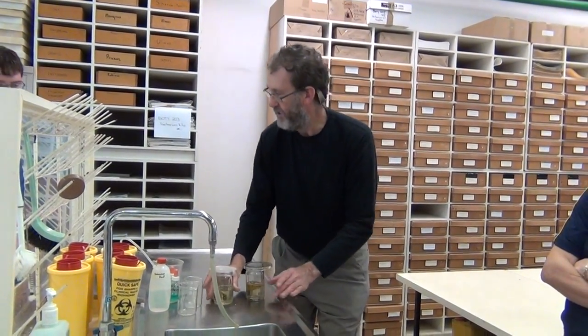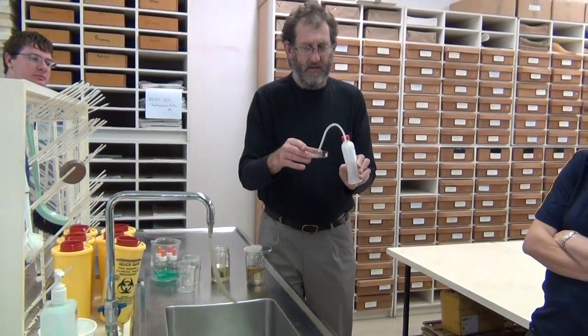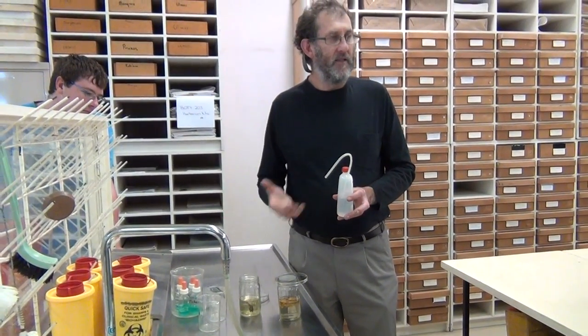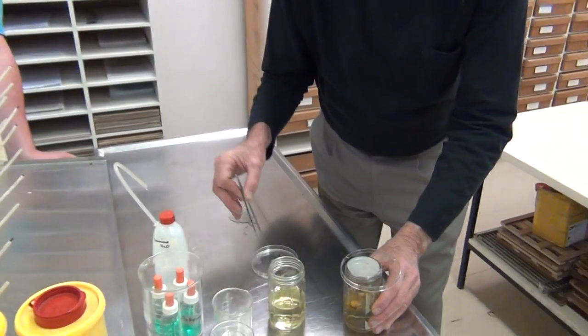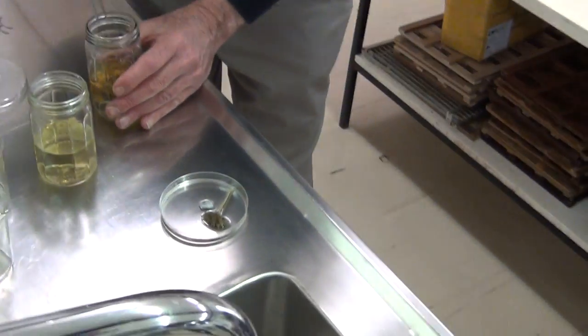Because this one has sunk, I'll show you the next step. We have a squeeze bottle of deionised water here, but unless you're somewhere with unusual water quality, tap water is fine — we're not doing any chemical analysis. Having rehydrated the samples, I want to keep them in water. You can see patches on the other specimen where it looks like it still needs longer; you could give it a dab, but I'd be inclined to just leave it.